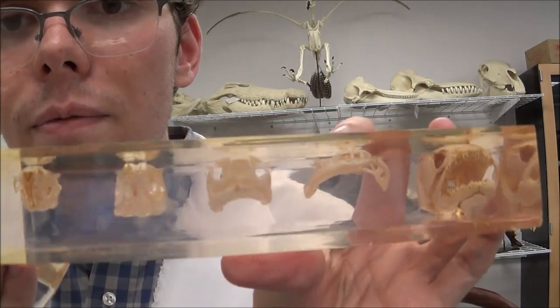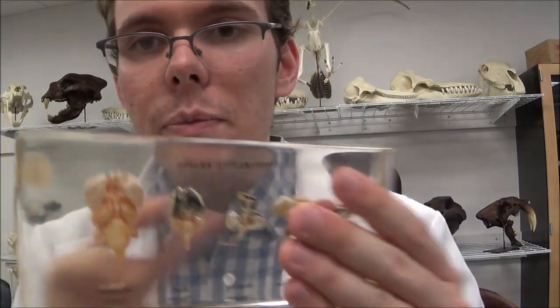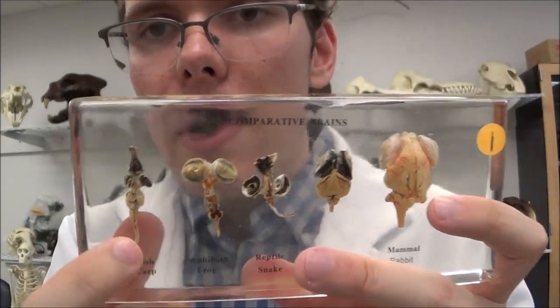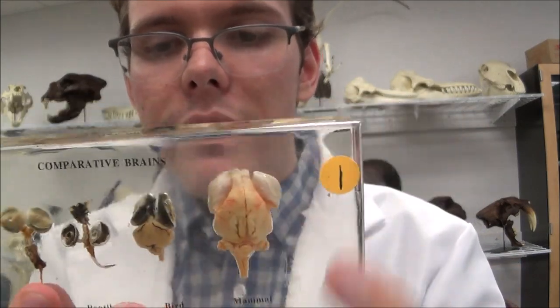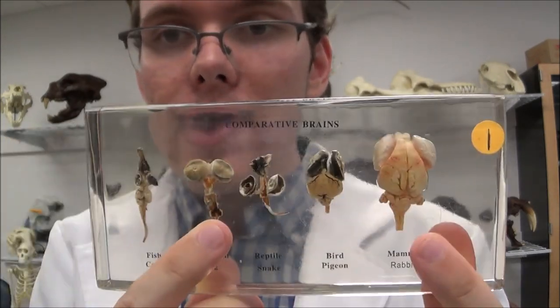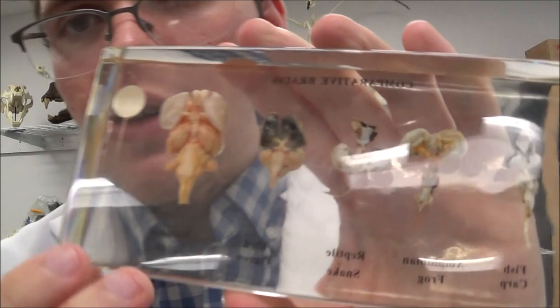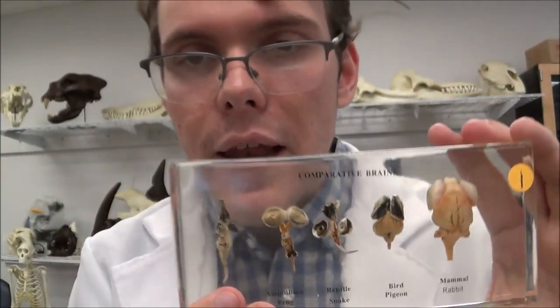You can see them face on that way if you want. Take a look at their differences in brains. The reason I said rabbit before is because this particular mammal here is a rabbit. So you've got a fish brain — the smallest and most basic of them all — then a frog brain, a snake brain (our reptile representative), a pigeon brain, and then a rabbit brain. Mammal brains are far larger and more complex than any of the other groups. Something cool to note there.